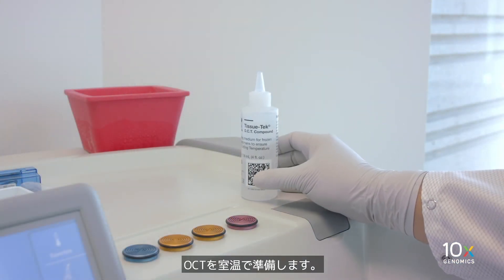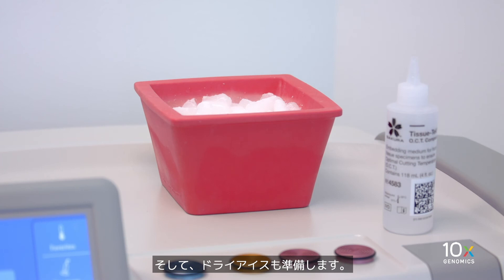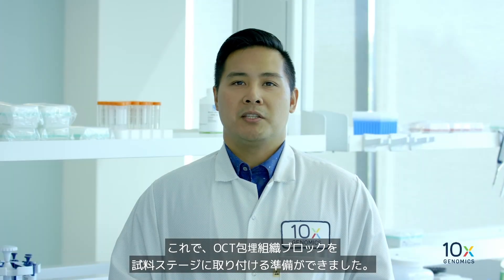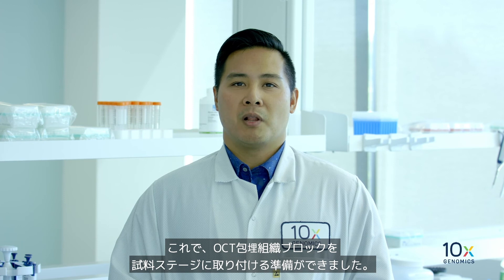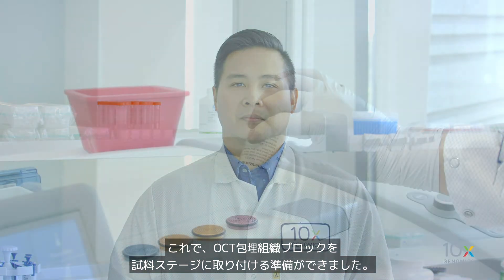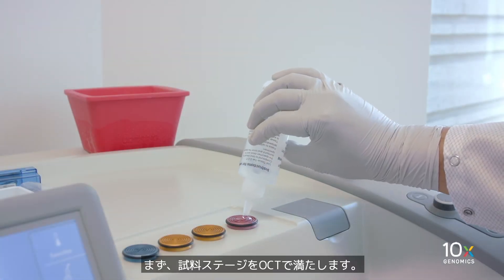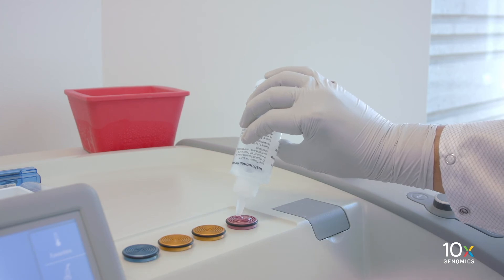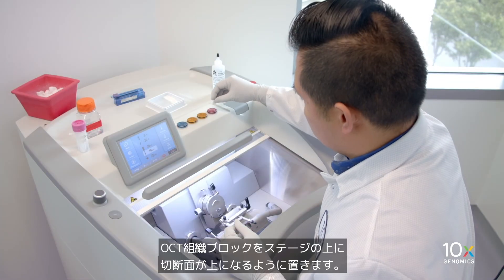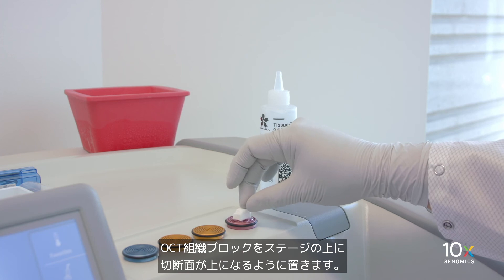We have the slide mailer cooling in the cryostat chamber, we have OCT at room temperature, and we have dry ice. Now we're ready to mount the OCT embedded tissue block onto the specimen stage. First, fill the specimen stage with OCT.